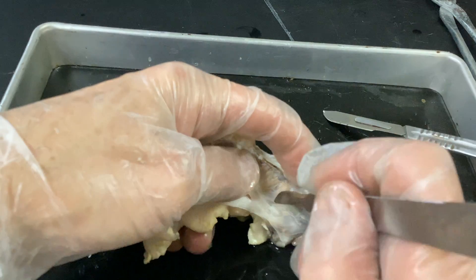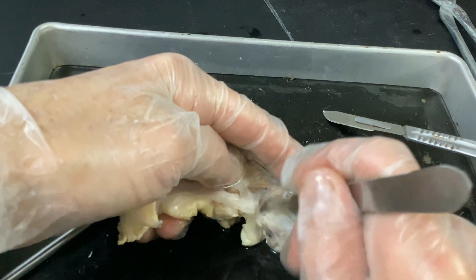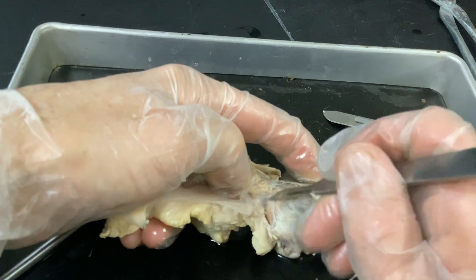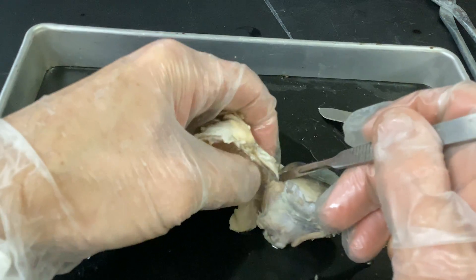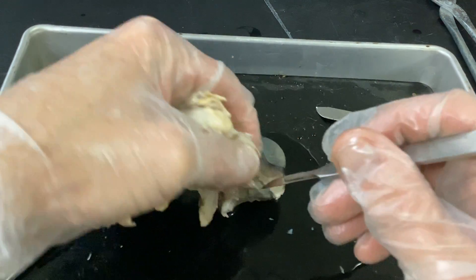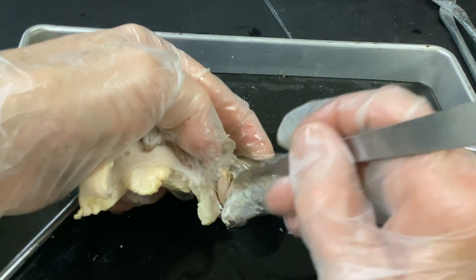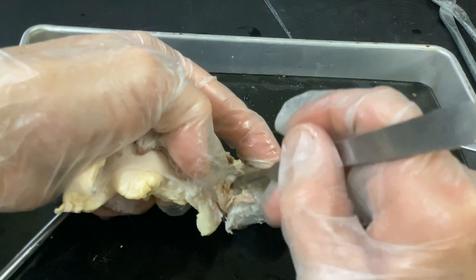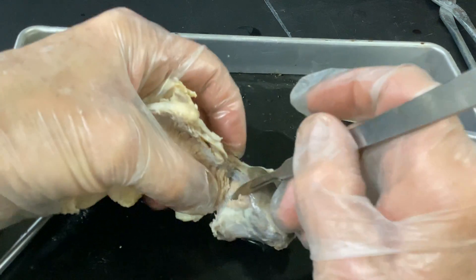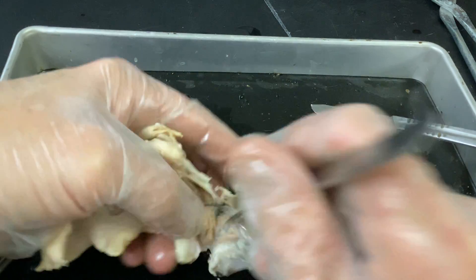Remember, we want that for structure — so if the human, cow, or bovine gets hit, the sclera is very durable, it's not going to rupture. We want it for structure but we don't want it destroying the anterior chamber with that aqueous humor or the posterior chamber with that vitreous humor.